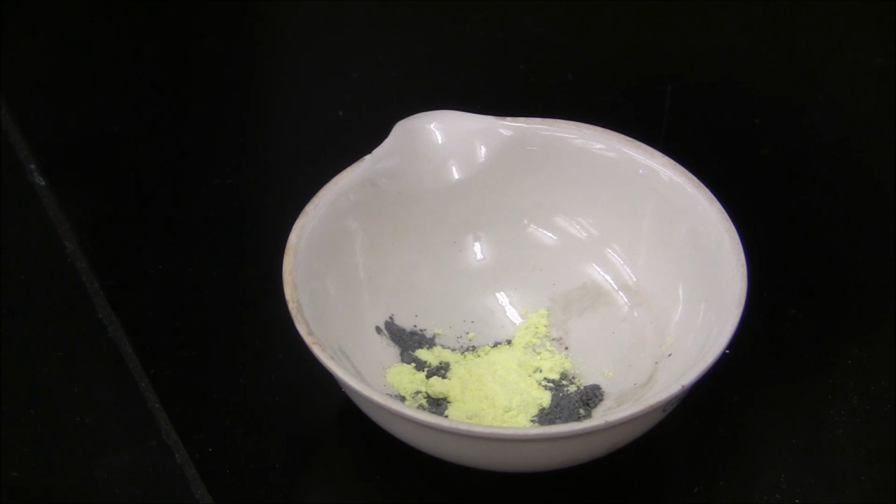You can actually tell because you can see the properties of the zinc and the sulfur. I've not created a compound between zinc and sulfur, I've created a mixture. In order to cause a chemical reaction to take place, we're going to have to supply energy, and we're going to do that with a Bunsen burner flame.